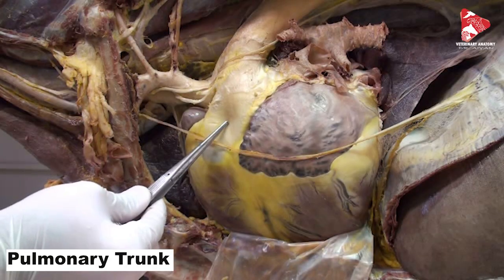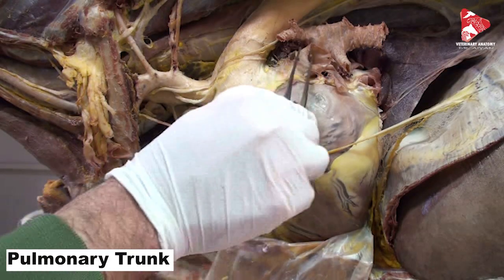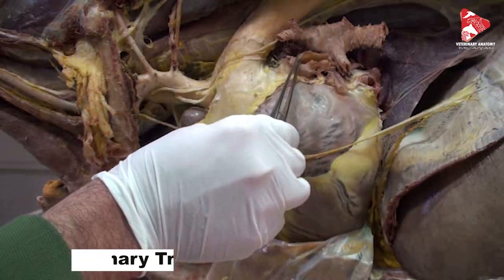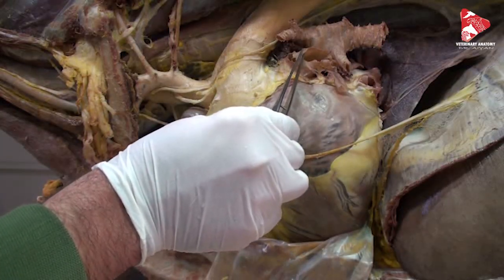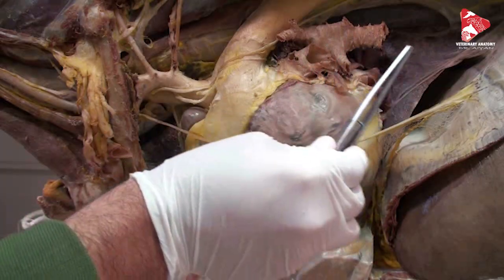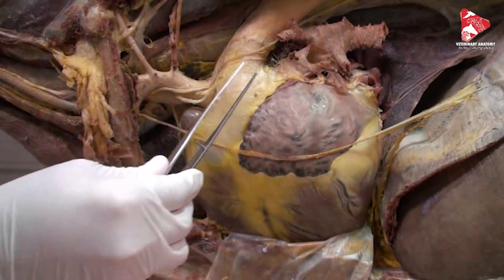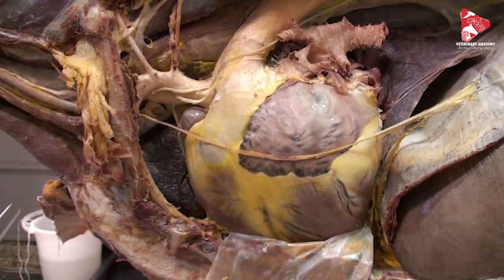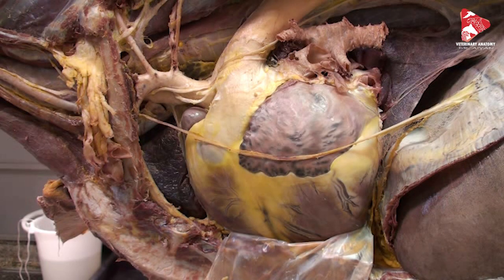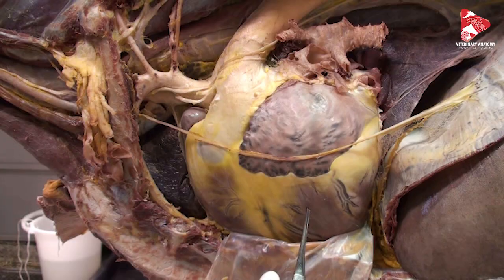From the right ventricle we have one very big artery called the pulmonary trunk. This is the pulmonary trunk, which moves dorsally and caudally, and at this level it gives two big branches called the pulmonary arteries — one to the left lung and one to the right lung.